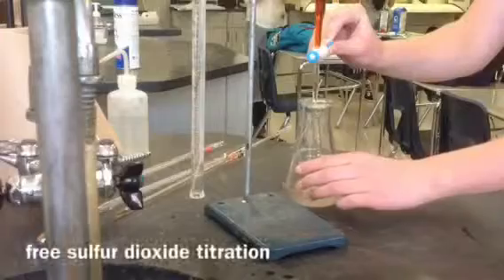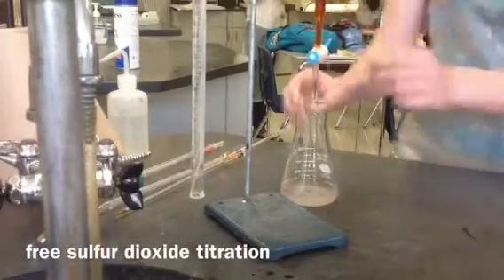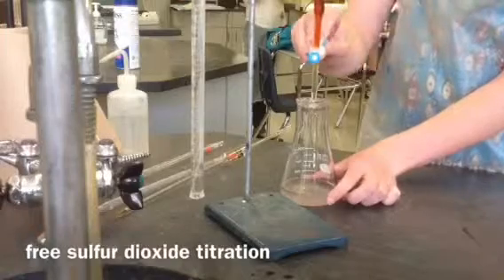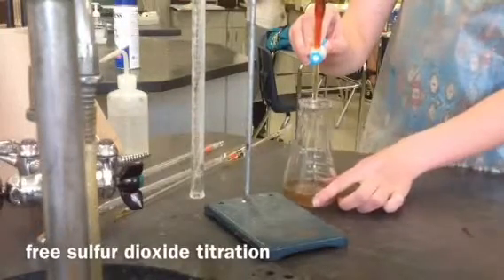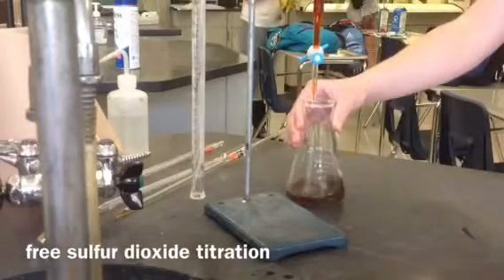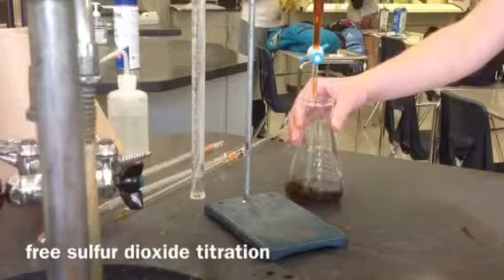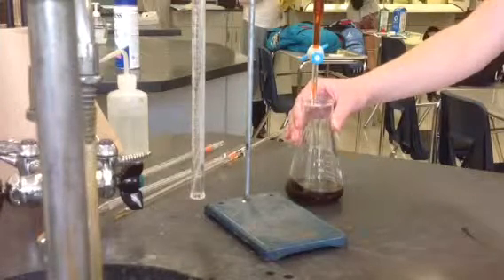To find the free SO2, I pipetted 50 milliliters of wine into a conical flask, and then put in 5 milliliters of sulfuric acid and 3 milliliters of starch solution. I reached the endpoint after titrating the solution with 3 milliliters of 0.01 molar iodine. After doing my calculations, the amount of free SO2 in the wine is 36 parts per million.